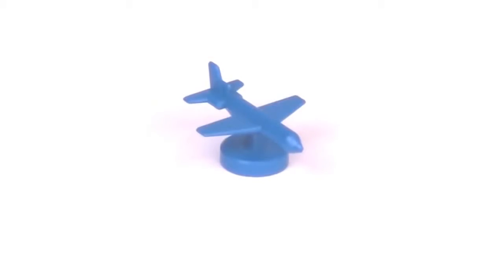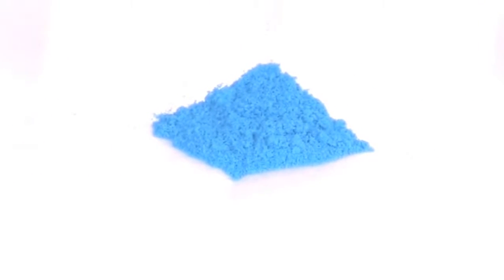Here is what your sample looks like before. Here is what your sample looks like 45 minutes after.